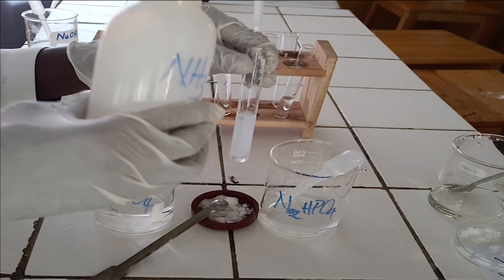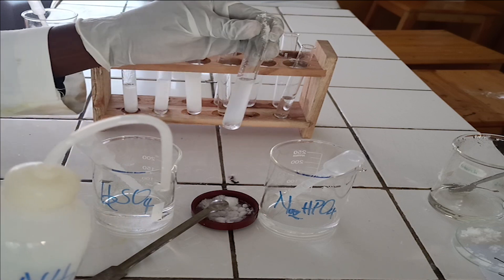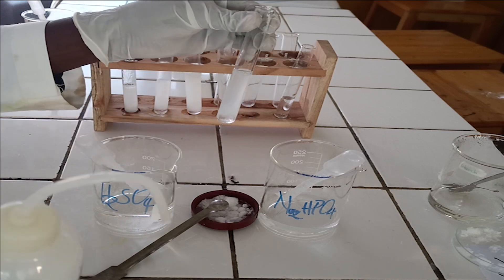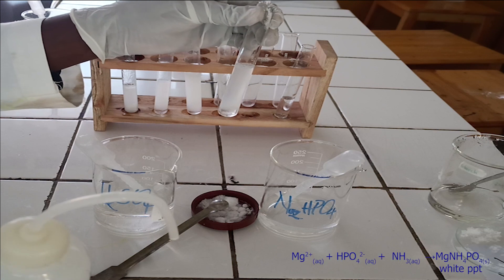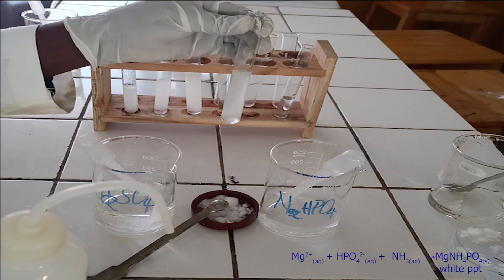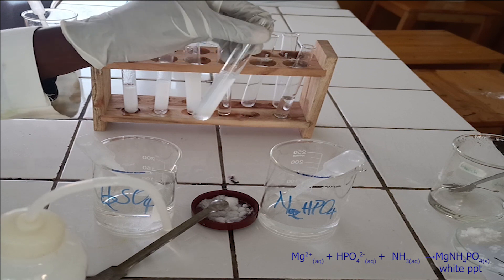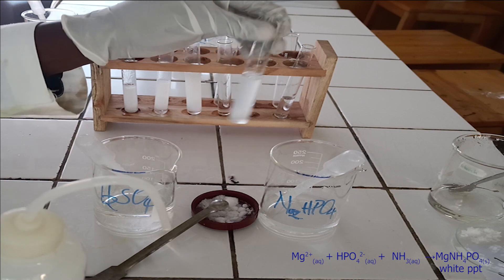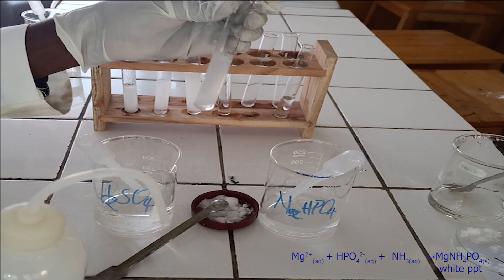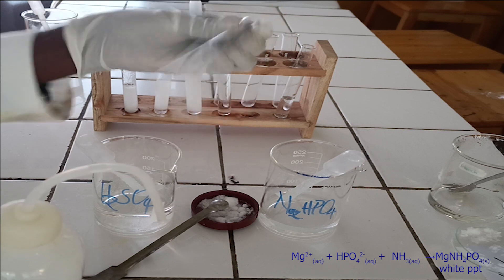As you see, disodium hydrogen phosphate and ammonia react with magnesium ion to form a white precipitate, which is insoluble in excess of ammonia solution. Below, there is the ionic equation for this reaction.